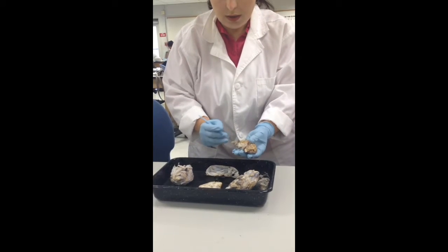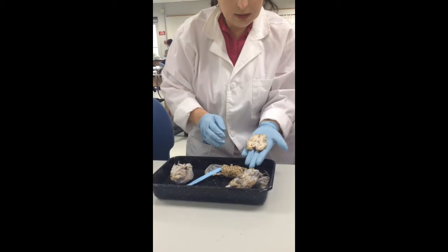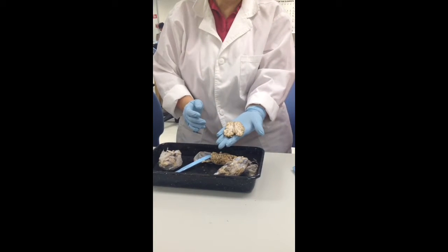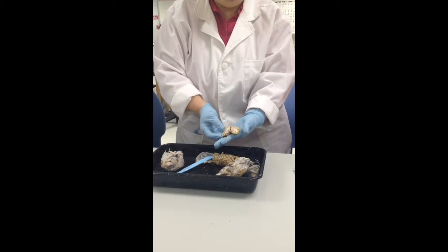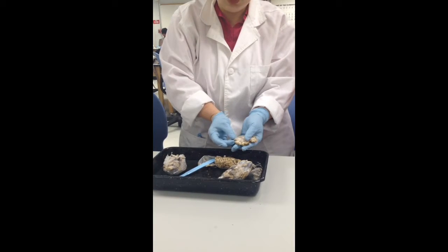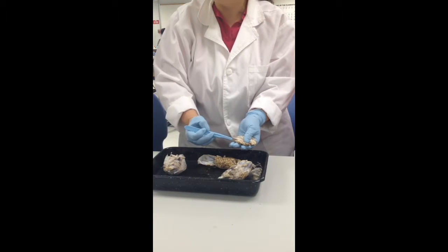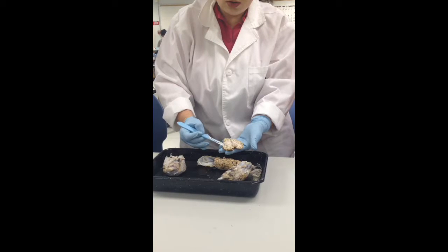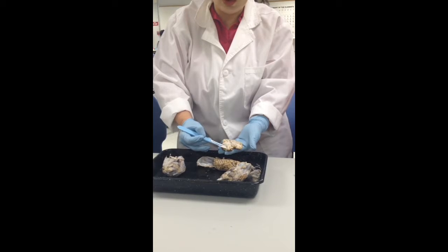Okay, all right. Now this section here is a really neat section. On this side, you're seeing closer to the top of the cerebrum. Okay, and you can see the fissure, which is your what? Longitudinal fissure. There's also another one right here, which is not as deep as the fissure, so what would that be? Right here? Yeah, it's a sulcus. So one is a sulcus, one is a fissure. Now this is white matter, and this is gray matter. And so this would be the cortex.